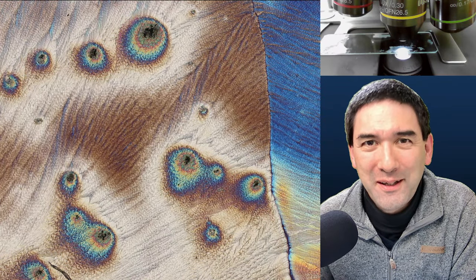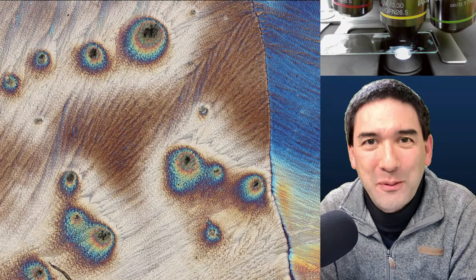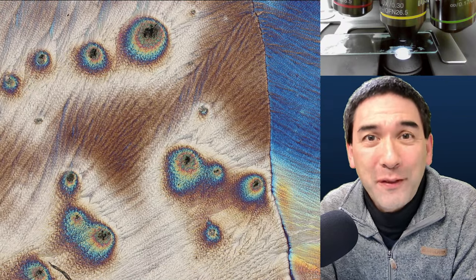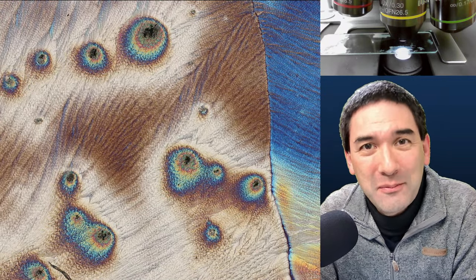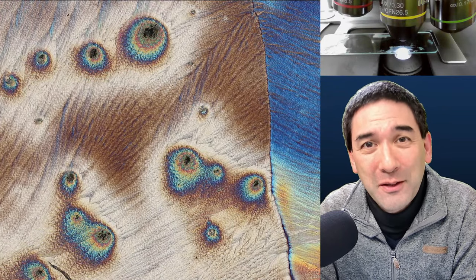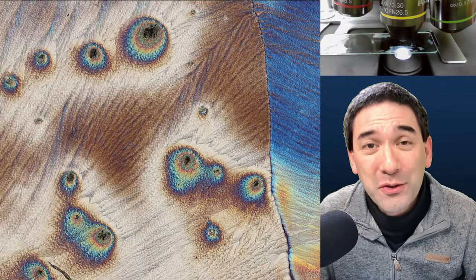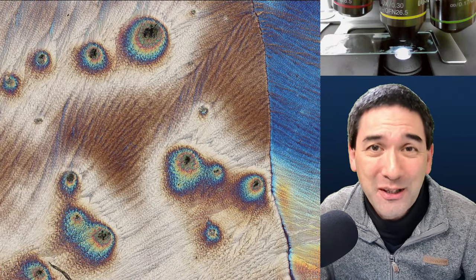Hi, hello everyone, welcome to another Saturday microscopy live stream. Microbe Hunter here, Oliver. Today I plan to do several things — not one topic but a little bit of a microscopy variety show, where I'd like to share some different aspects. Some of my viewers have also volunteered to share pictures and videos that I'd like to show you today.